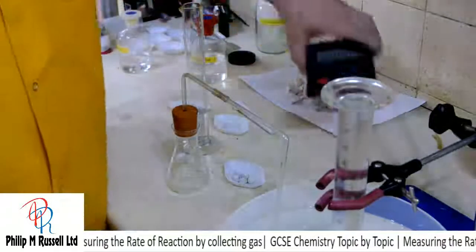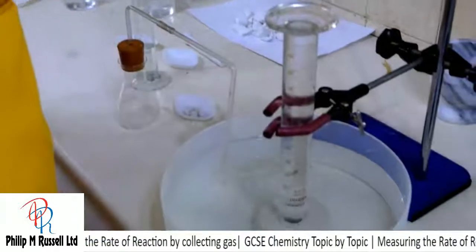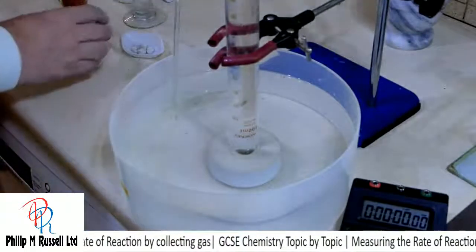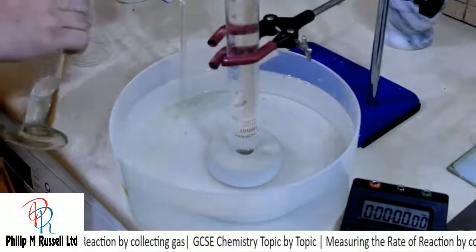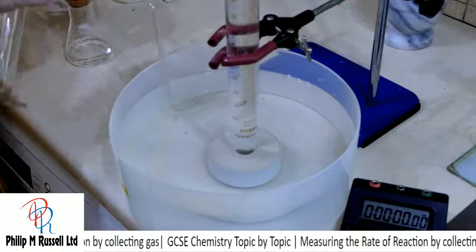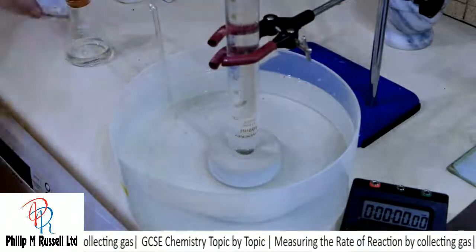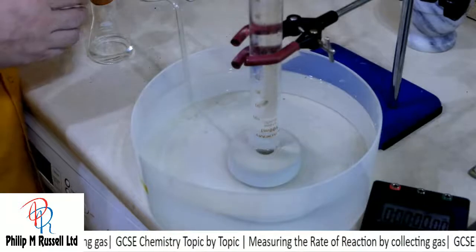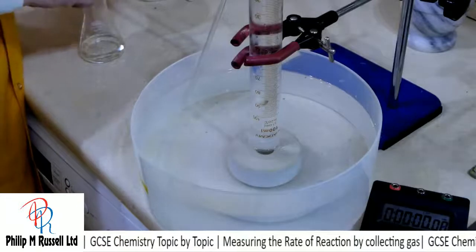I've got my stop clock ready to go. So I'm going to put the stop clock down this side so that you'll be able to see it in a minute. We've got our acid in there. Let's just put the acid in there. And let's measure how we go. We've done this experiment once before, so this time we're really having a look at a different technique. 3, 2, 1, go.